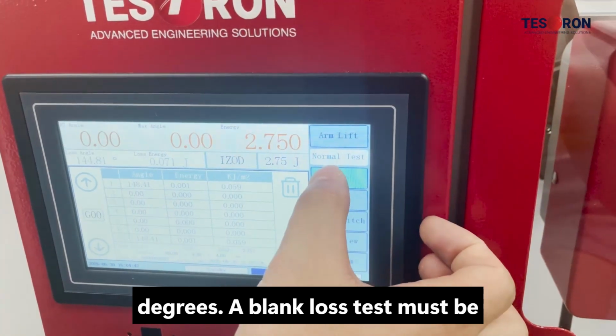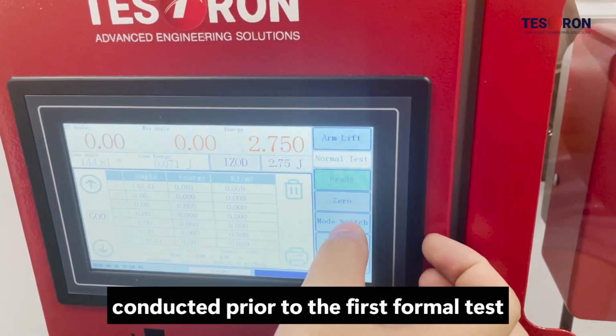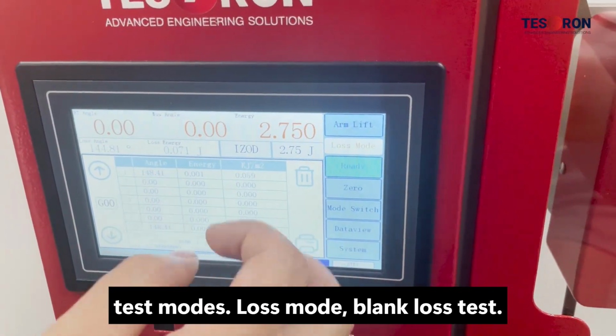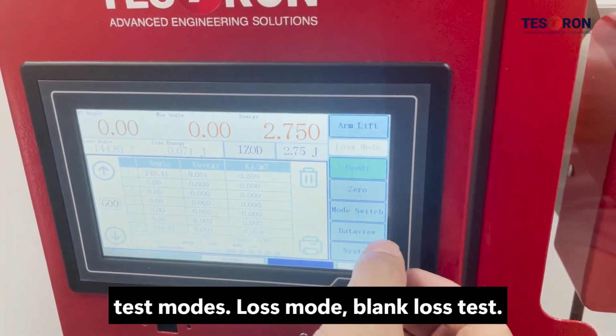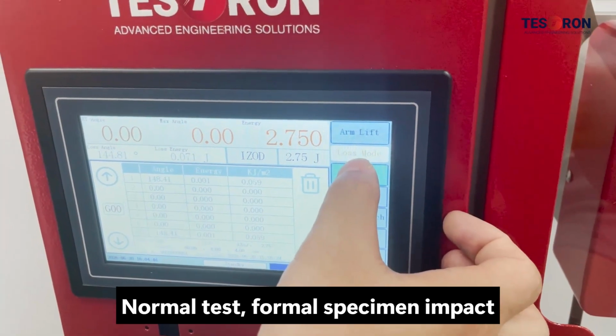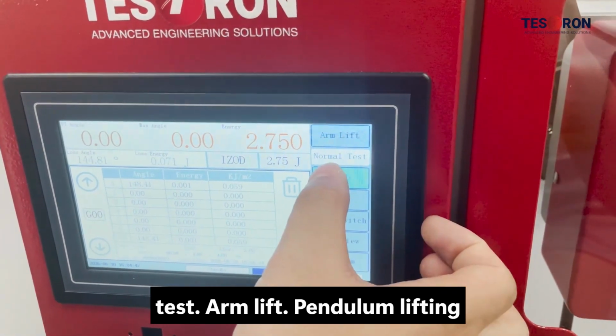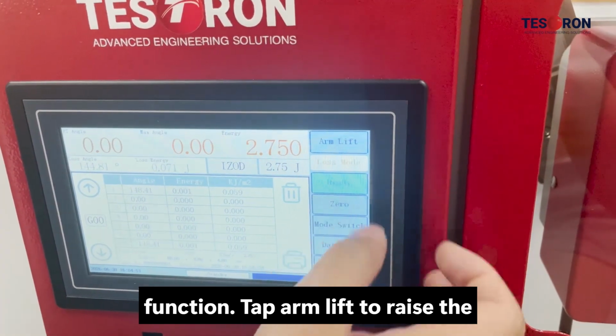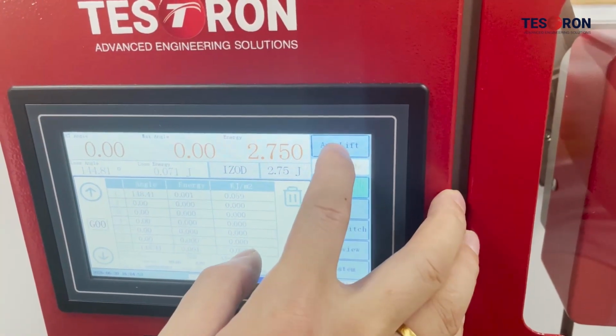A blank loss test must be conducted prior to the first formal test after startup. Tap Mode switch to toggle test modes. Loss mode, blank loss test. Normal test, formal specimen impact test. Arm lift, pendulum lifting function. Tap arm lift to raise the pendulum.